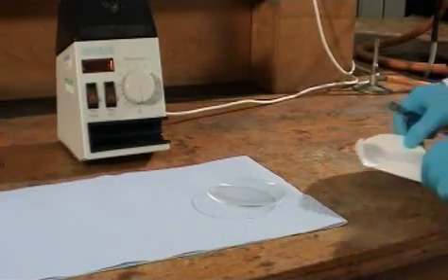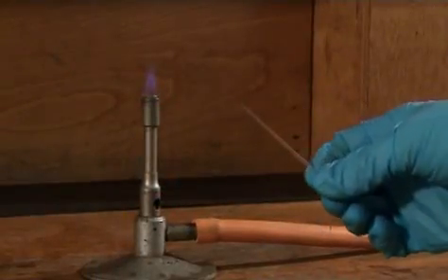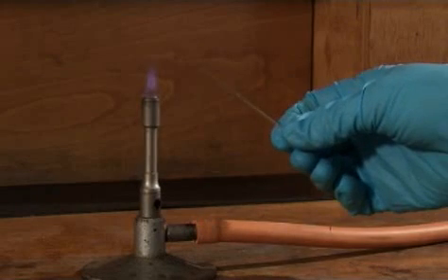We're going to get a melting point of this compound we've just recrystallized. A melting point tube can be made by sealing the end of a capillary tube.